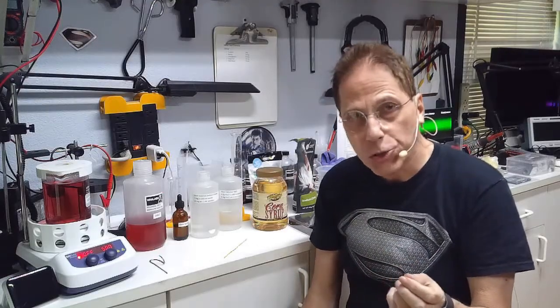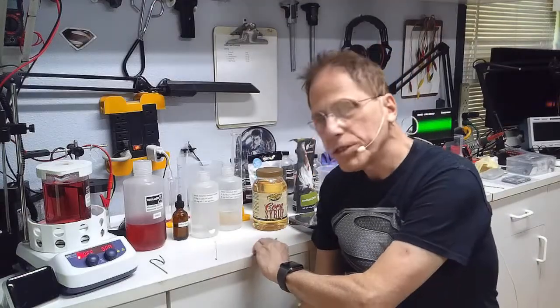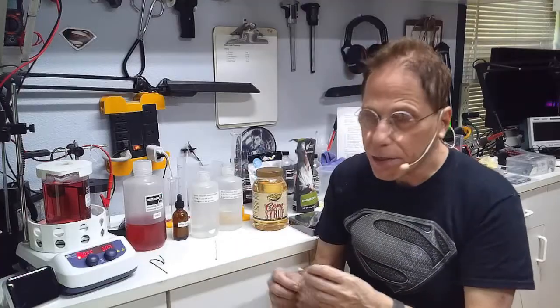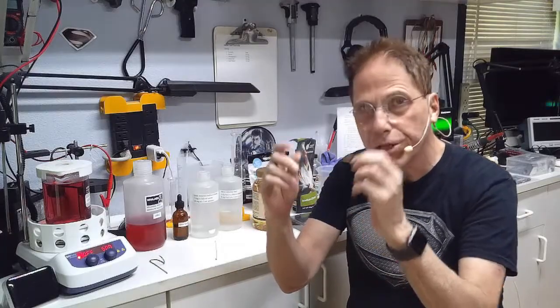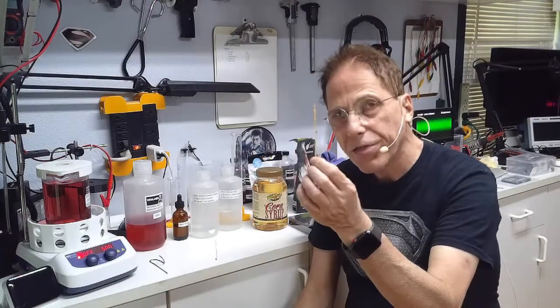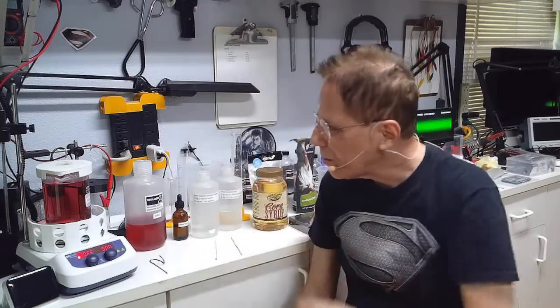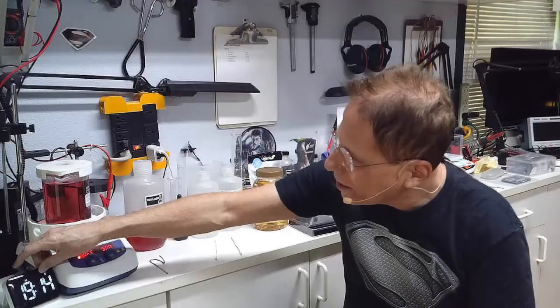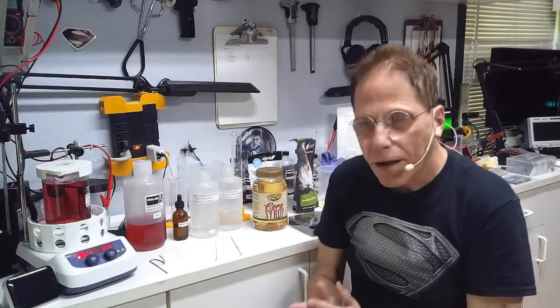I didn't want to waste the old wire, so I twisted the two together. Then I had two twisted pairs of gold wire. Since I make quite a bit of gold, this piece is now a bunch of used twisted gold wires all together. The thicker your gold wire cathode, the faster it's going to cook. This last batch I just made cooked in 19 minutes and 14 seconds.